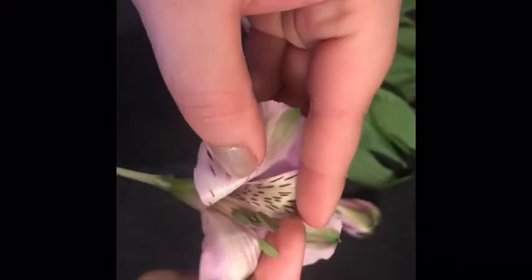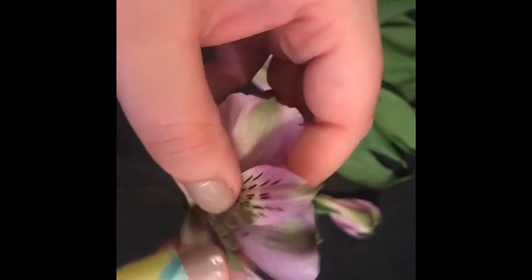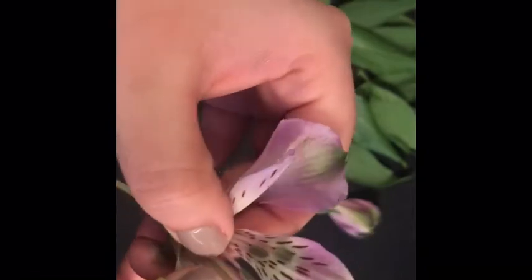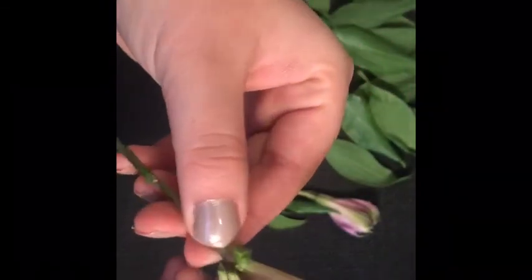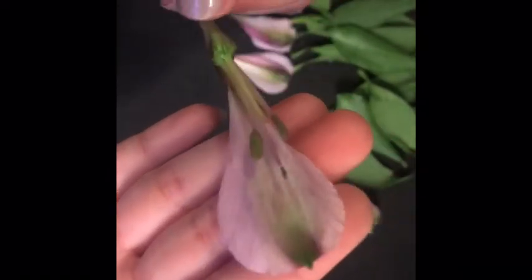So it will collect the pollen on its little sacs on its legs and on its fur, and then it'll buzz to a new flower, and as they're rummaging around in here, that pollen will come off, and it'll get stuck here on the stigma right here, and then it'll go down deep inside our ovary. Oh, sorry if you can't even see that.